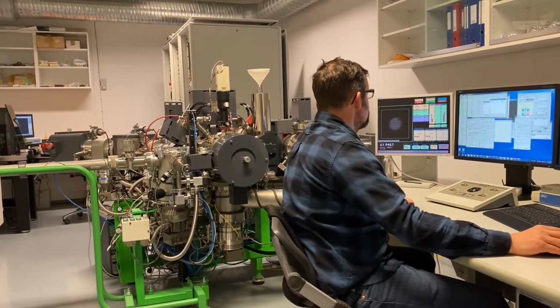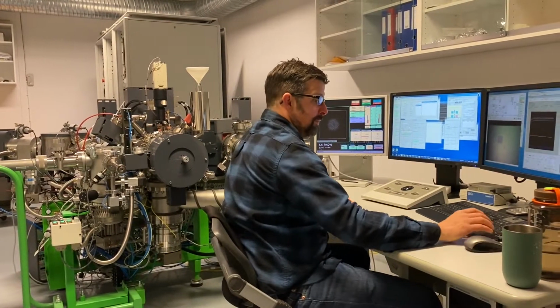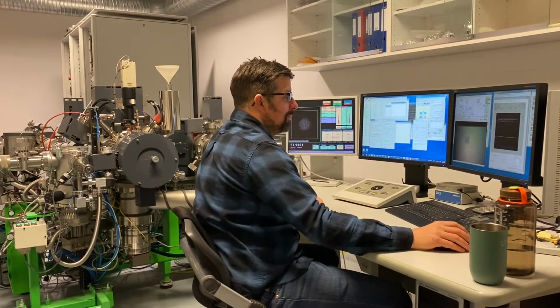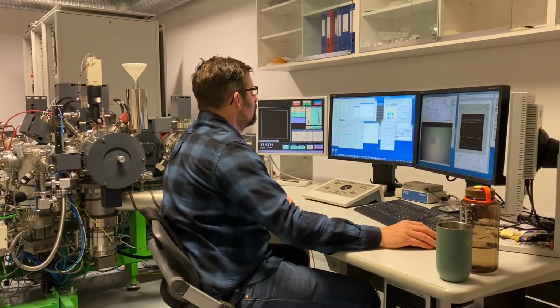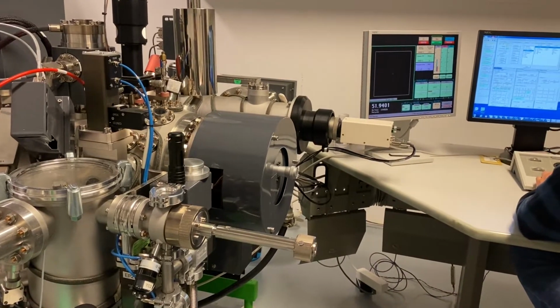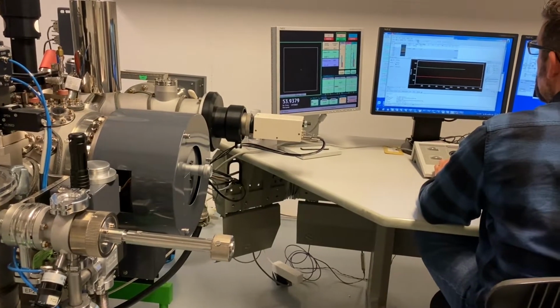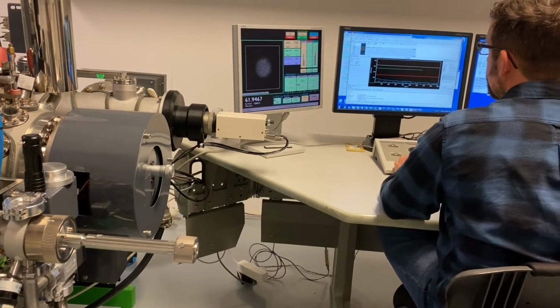But a more common application is to measure the distribution of your species in a Z direction. So with this, SIMS is a perfect tool to, for instance, study diffusion. Another way of using SIMS is to simply measure a mass spectra, which allows to determine which kind of species or elements you find in your sample. With the SIMS at MiNaLab, we can detect almost all elements, including hydrogen, but excluding noble gases.